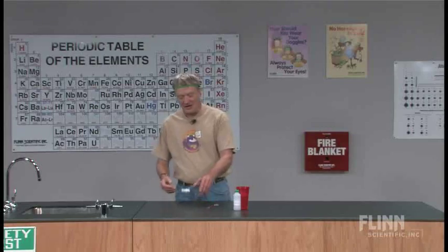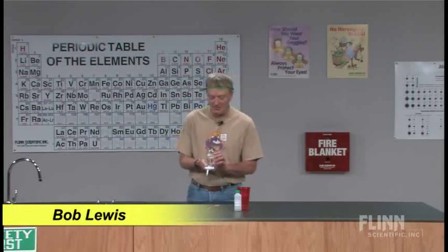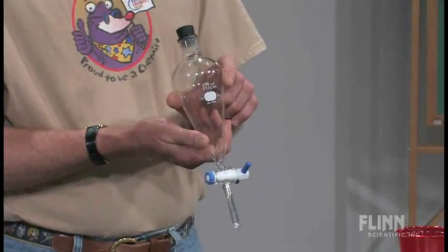I have here a piece of laboratory equipment that some of you may be familiar with and some of you may not be familiar with. This is called a separatory funnel. Sep funnels are used to separate immiscible liquids.